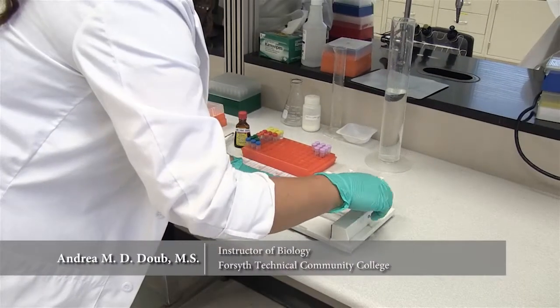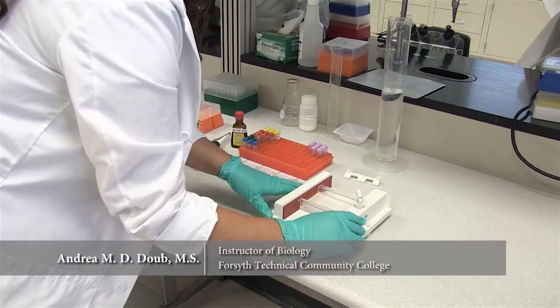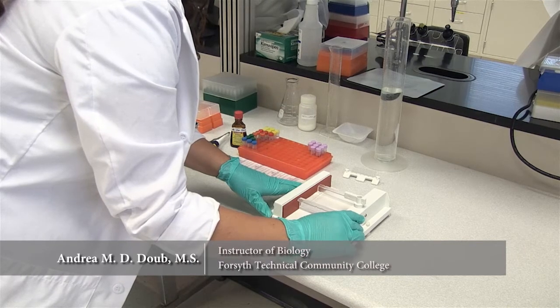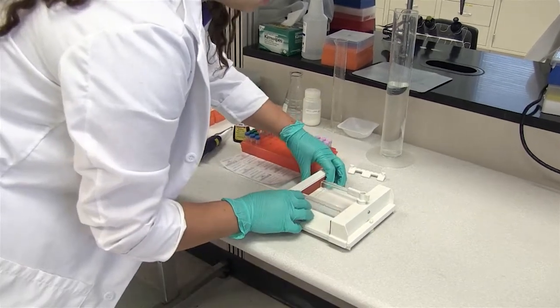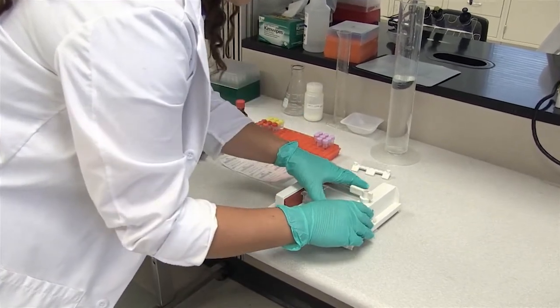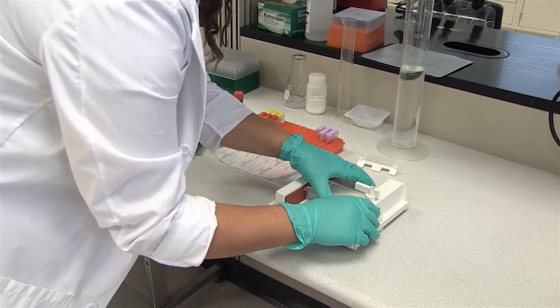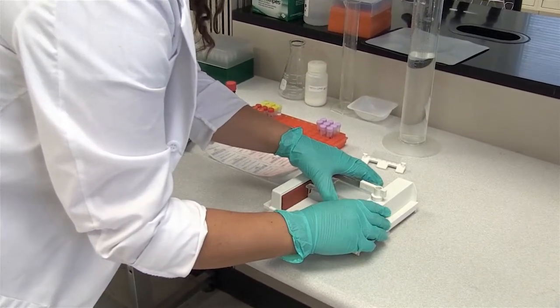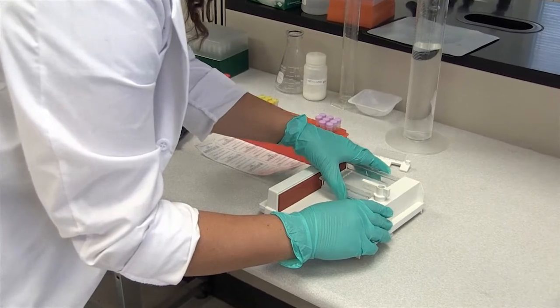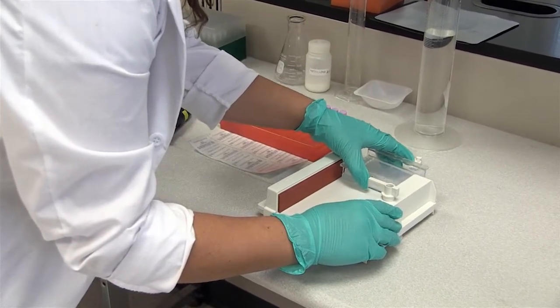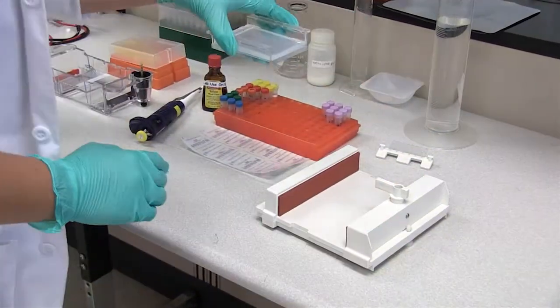So the next thing we'll do is release the sides of our dams, which can be tricky sometimes because of suction, which I'm having a slight issue with at the moment. But there we go. And now we're free.